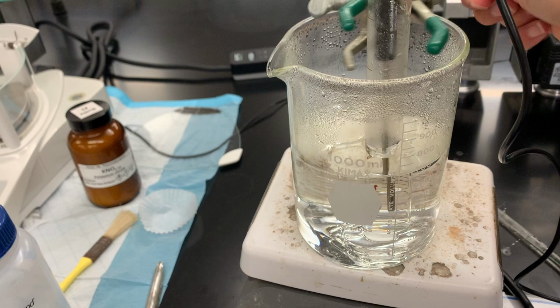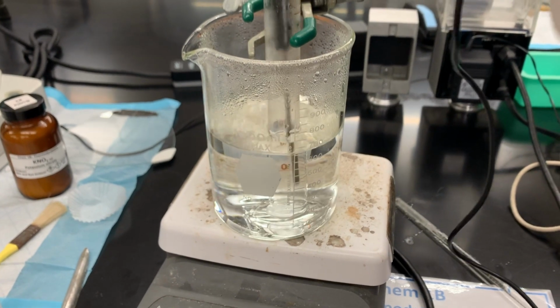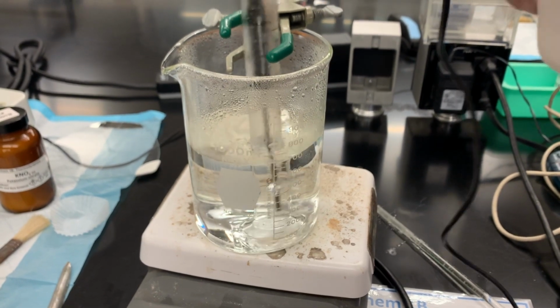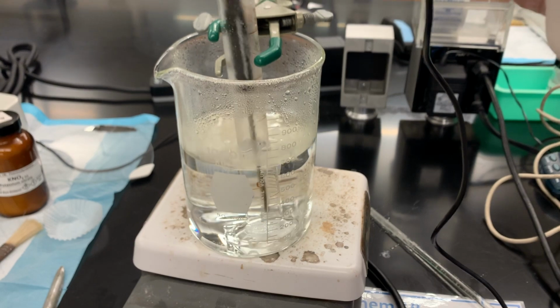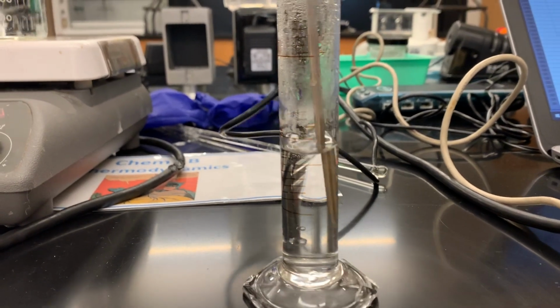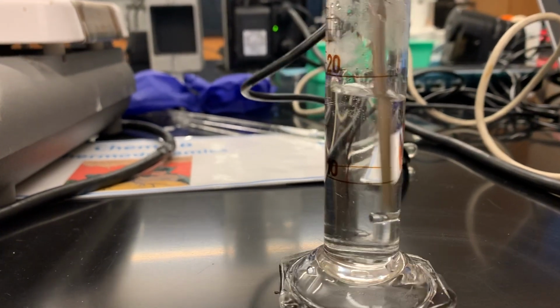Okay, clamp it in, and I'm going to heat it up to dissolve it because we had crystals and they all need to dissolve. And then I'm going to do the same thing again. I'm going to take it out and wait for the first appearance of crystals to form, and as soon as I see those crystals form, I will hit keep on the computer. Okay, so I'm going to agitate this again and wait for the first appearance of crystals.